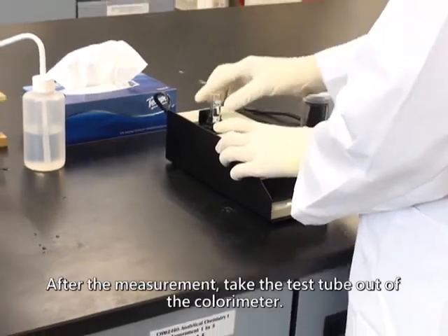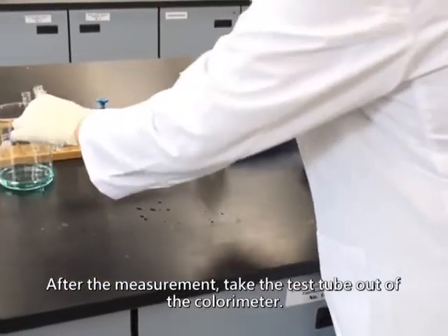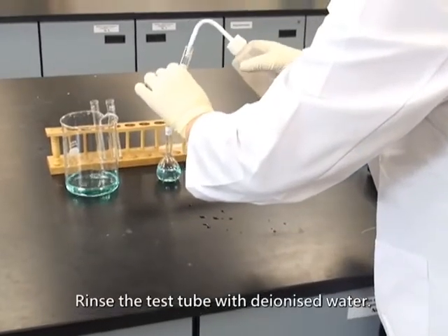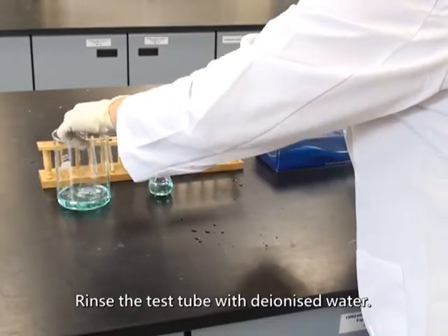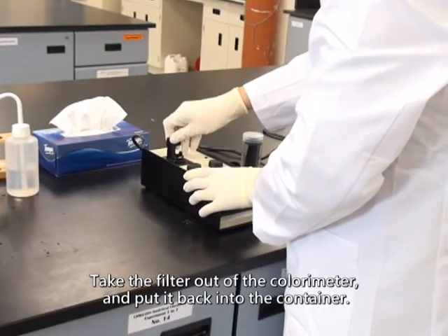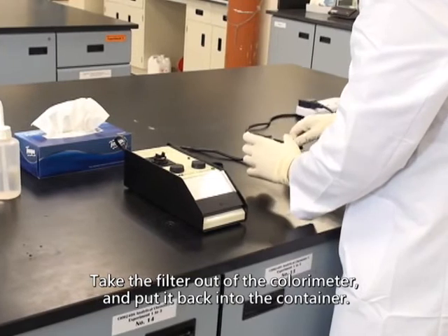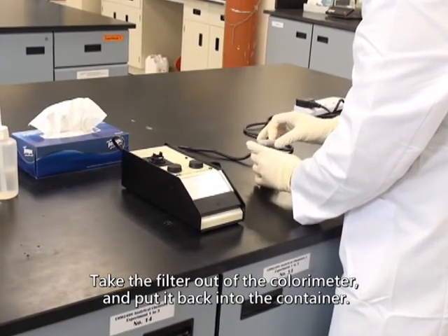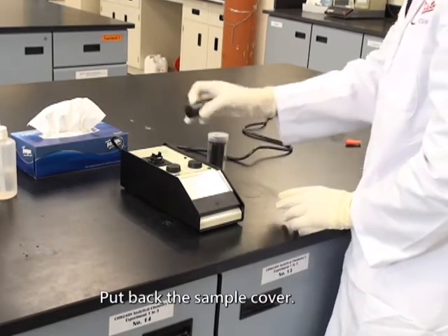After measurement, take the test tube out of the colorimeter. Rinse the test tube with deionized water. Take the filter out of the colorimeter and put it back into the container. Put back the sample cover.